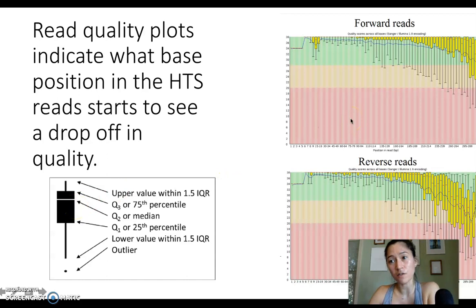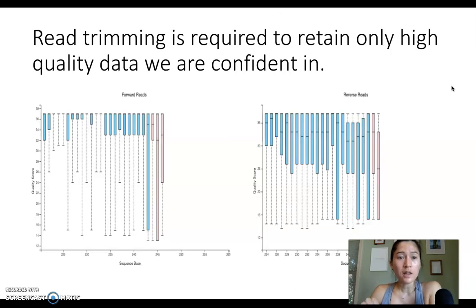The cutoff that I'm using for our lab this week is to find where the bottom of the sequencing quality boxes gets below 20. That's basically too low of quality, and we don't want to use those reads. But anything above 20, we would consider acceptable. As I've alluded to already, read trimming is required because we want to retain only high quality data we're confident in.